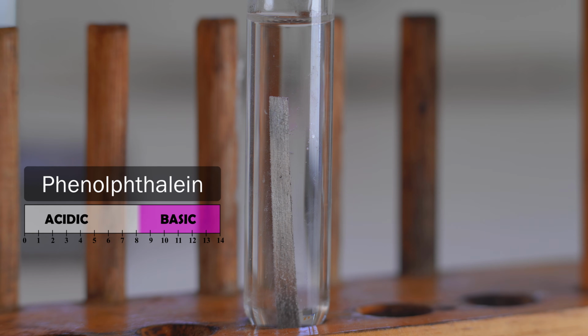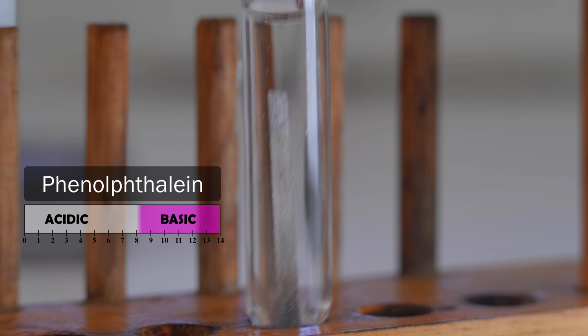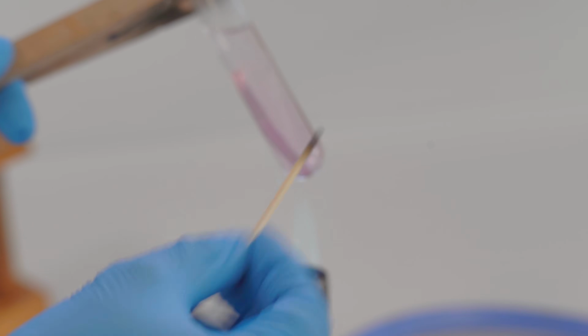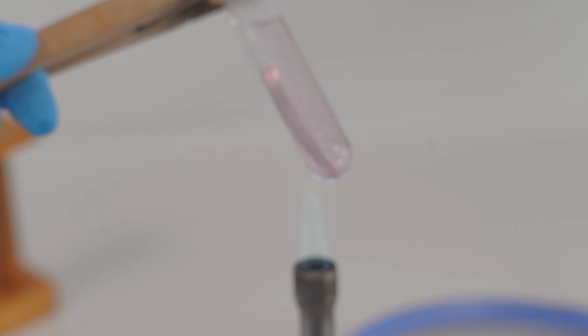What we can do is grab this test tube and put it over a Bunsen burner just to warm it up a bit. The reason adding heat makes this happen faster is that you add energy to each of those water molecules to react with that magnesium, so we're getting more contact between the two substances, and we're starting to see this pink color develop. That's the indicator I was speaking to you about earlier. Now we're going to turn our attention to calcium.